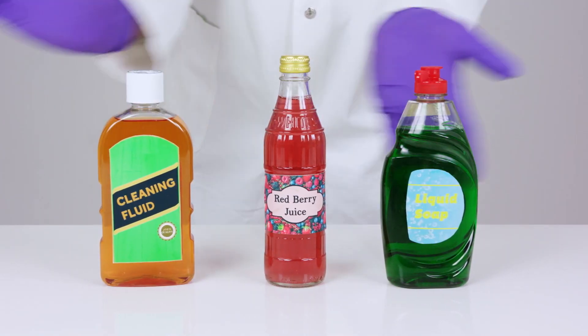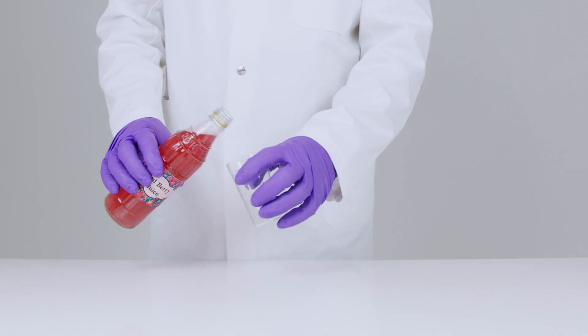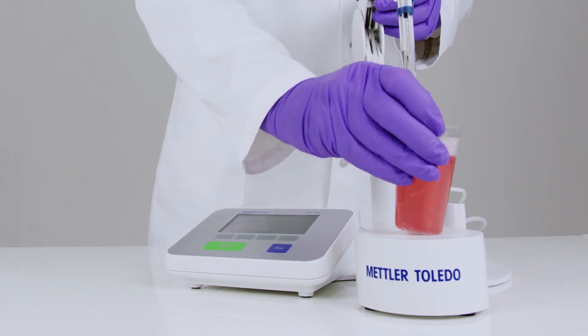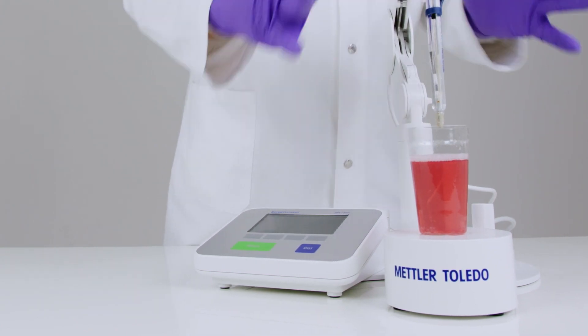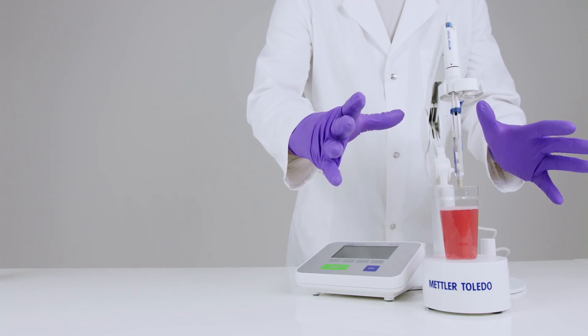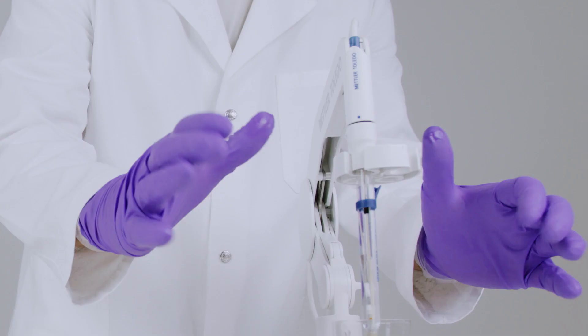So, you want to measure the pH of your samples. Want to check everything is in hand and you're not too acidic or too alkaline. But wait, stop Hans. If you want to take accurate measurements, you must calibrate before you use the sensor.